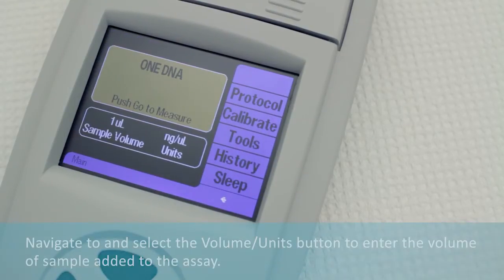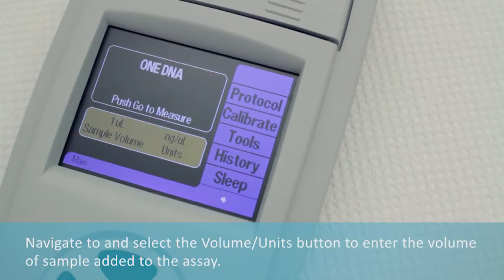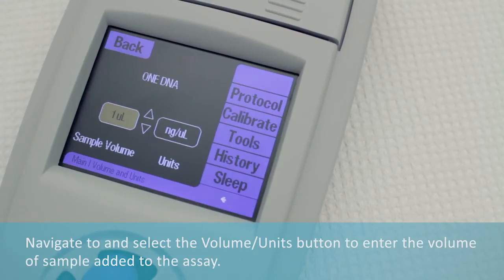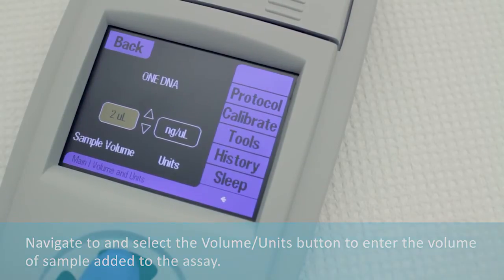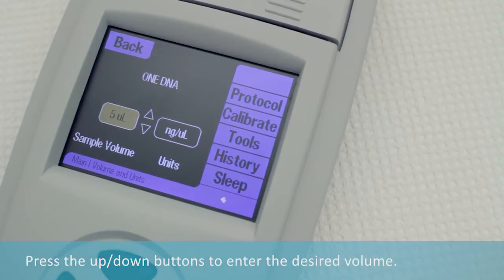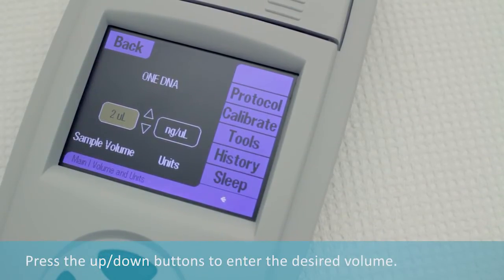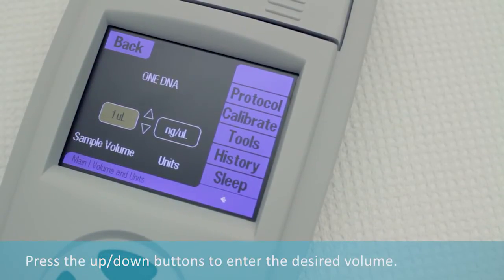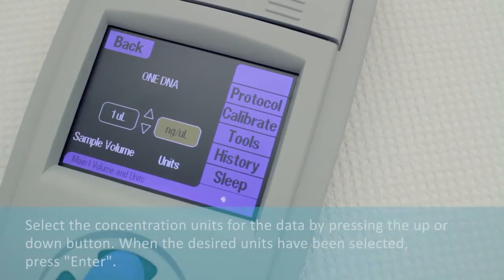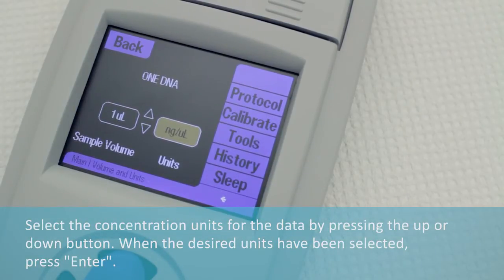Navigate to and select the Volume Units button to enter the volume of sample added to the assay. Press the Up or Down buttons to enter the sample volume.